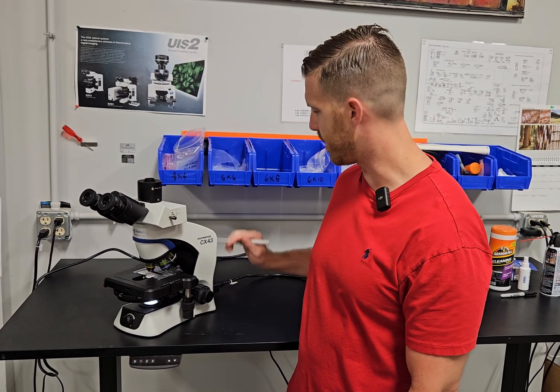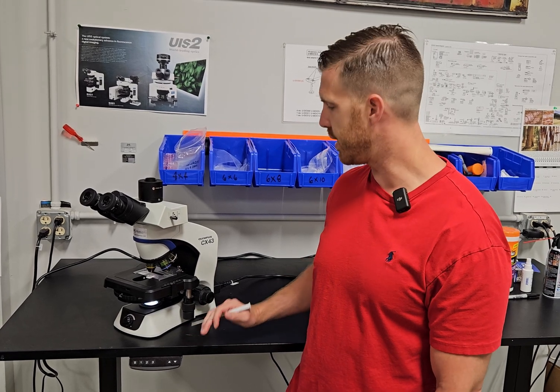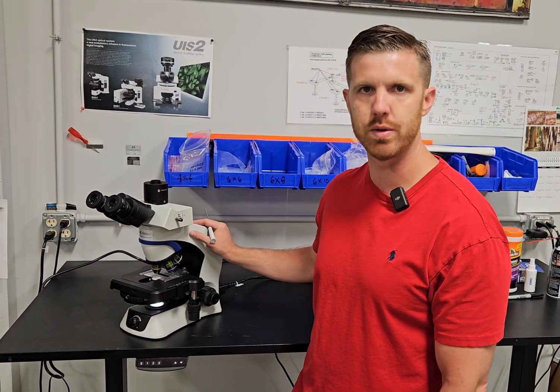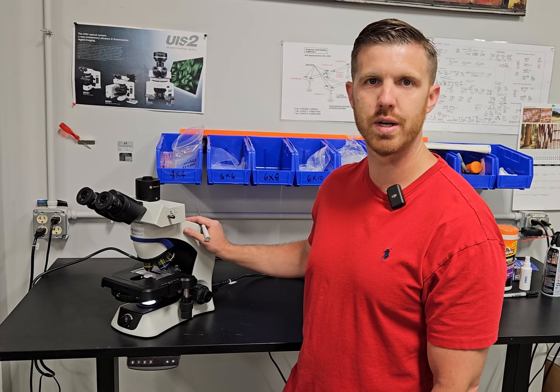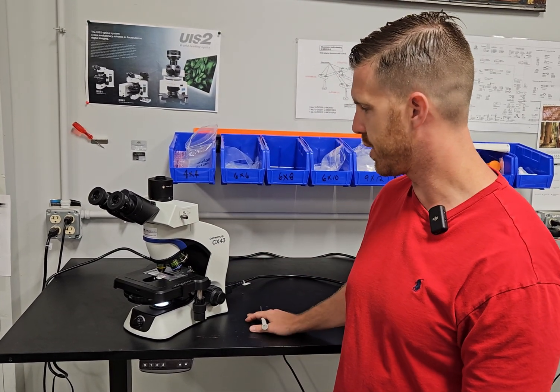Good morning, this is Chad with Monday Scientific. Today we're going to talk about this Olympus CX43 microscope. This one's configured for phase contrast and it's going out to an end user, so we're going to help them out with this video and show them the basic how-to on this scope.